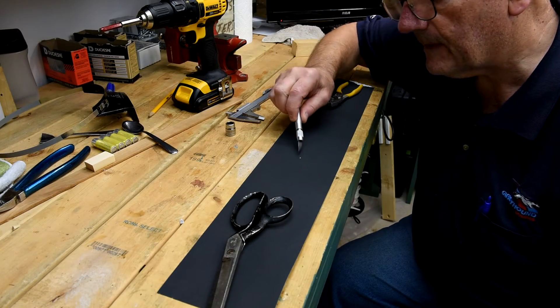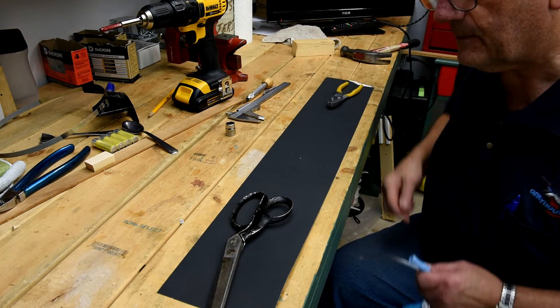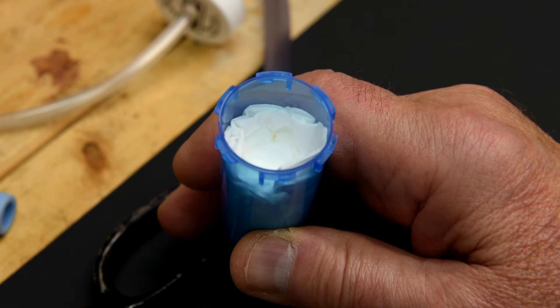Well I don't know if you can see it, but there's a little tiny piece of sawdust here. That's supposed to represent the little bug. Trust me, it's in there.